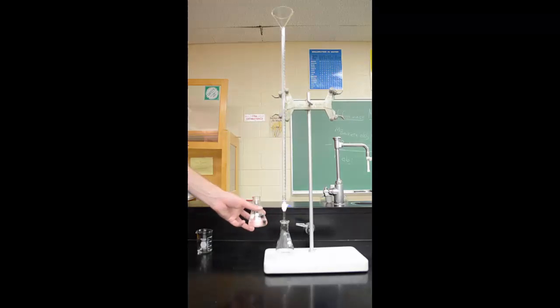Here's the liquid, water in this case, but it could be acid or base or a number of other things. We're going to fill up our burette. Keep in mind that this only holds about 50 milliliters, so you don't want to fill up the funnel too much. Just be very gentle. It doesn't need to go all the way to zero. You just need to fill it up so you can actually make a reading.